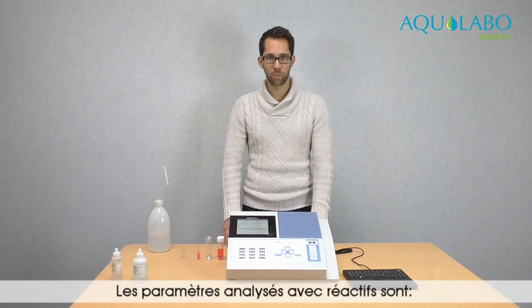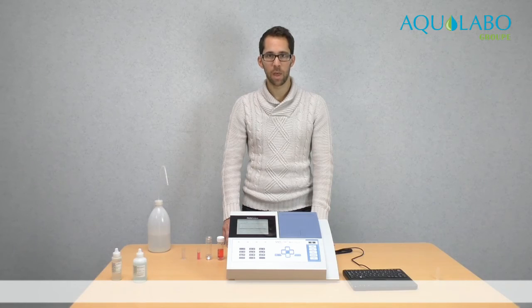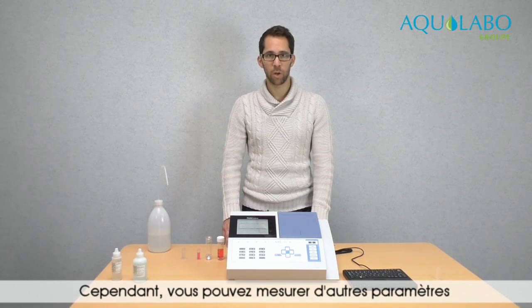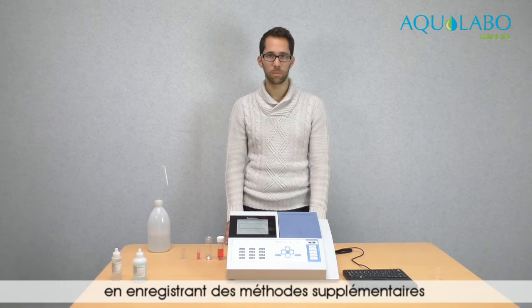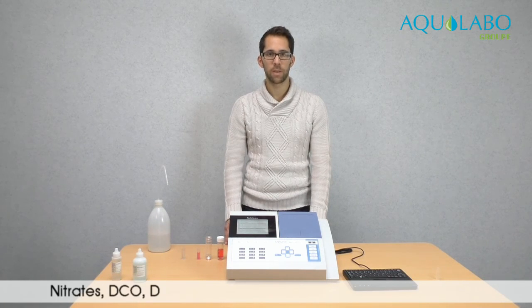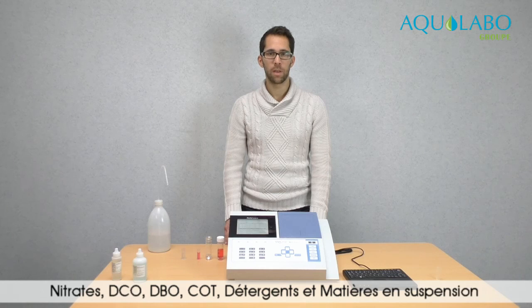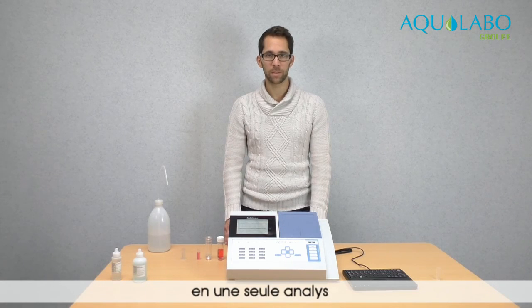The parameters with reagents are nitrates, COD, phosphates, ammonia, and total nitrogen. However, if you wish to measure other parameters, you can record new methods. The parameters without reagents are nitrates, COD, BOD, TOC, detergents, and suspended solid. It is possible to measure all of these parameters in just one analysis.